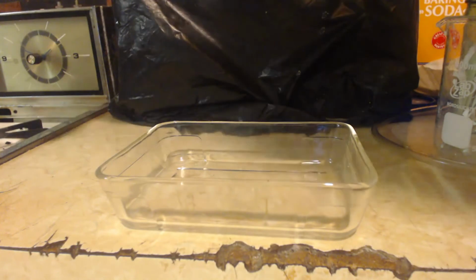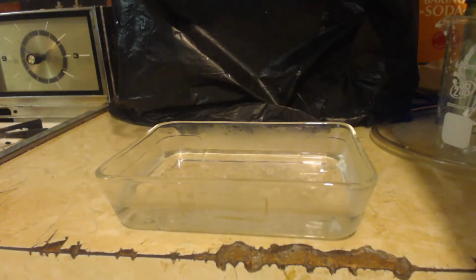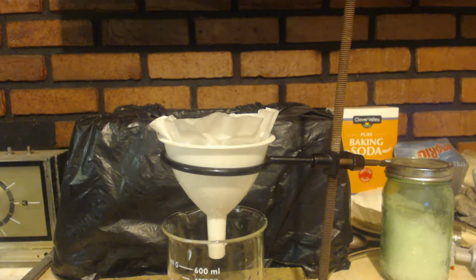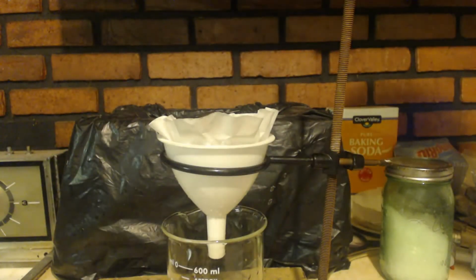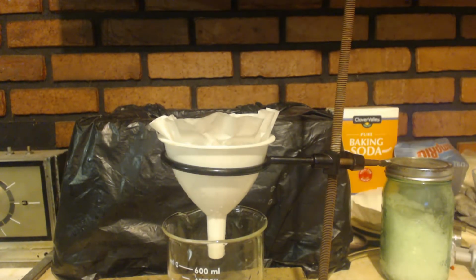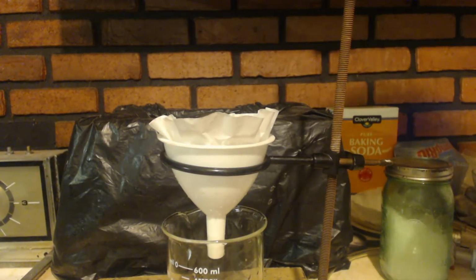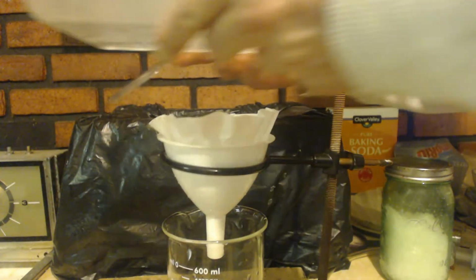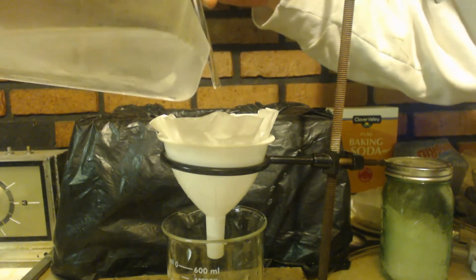So it's cooled down, so I'm going to pour it into here. And we'll let it crystallize from there. Alright, I got to change the plans. I think this is calcium sulfate that's coming out. Look how much water that is. That's like 300 milliliters. Now, I've only made about 27 grams of ammonium chloride. I only need maybe 35, 40 milliliters of water for it to dissolve. But there's no way anything can be coming out of solution yet. So I'm going to pour this in here and filter that out.